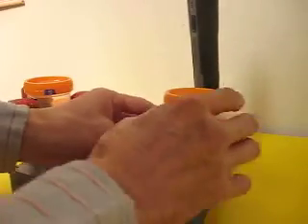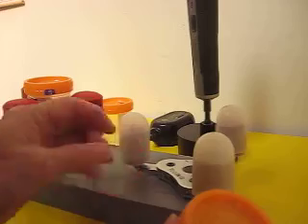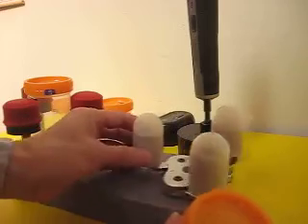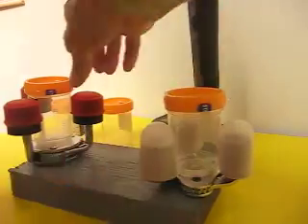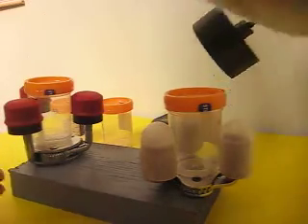All right, so let's put it back to holding position ready for decapping. Make sure this is tight.